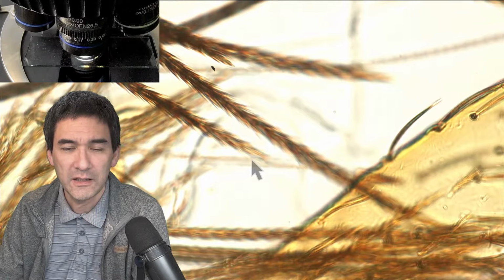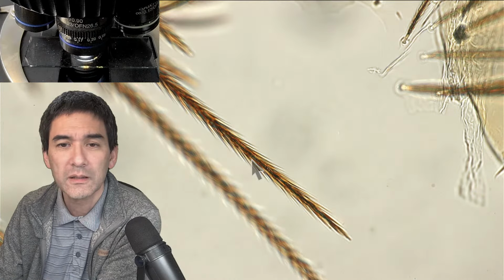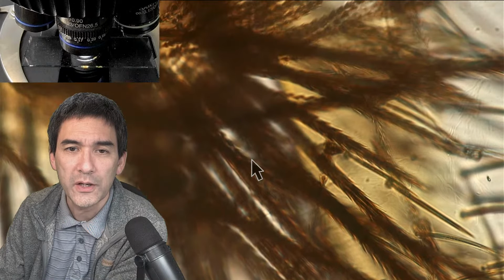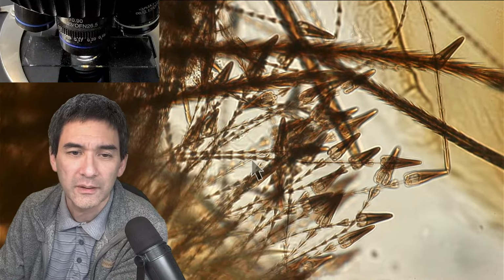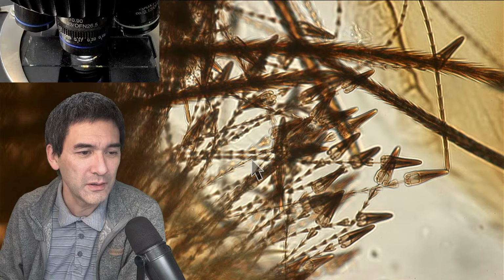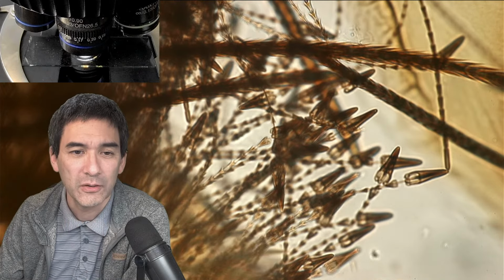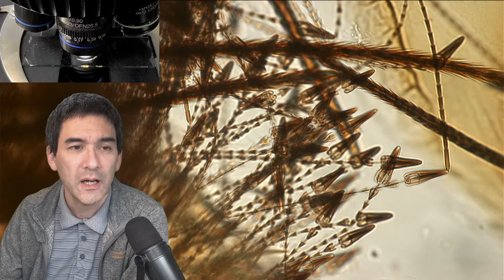You want to find a clean view of the arrow hair? Yes. Where is it? Let me go down a little bit. I have to find them. There were plenty of them. Here's one. Yeah, because they have those weird looking arrow hairs. Basically, setae they're called. Setae is a general term we use when referring to the hair of insects. It's a general term.